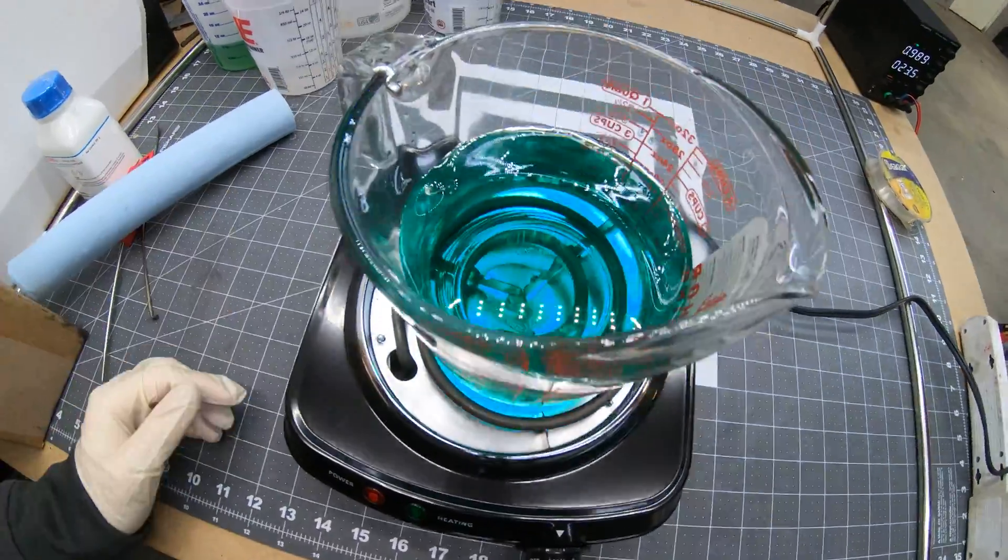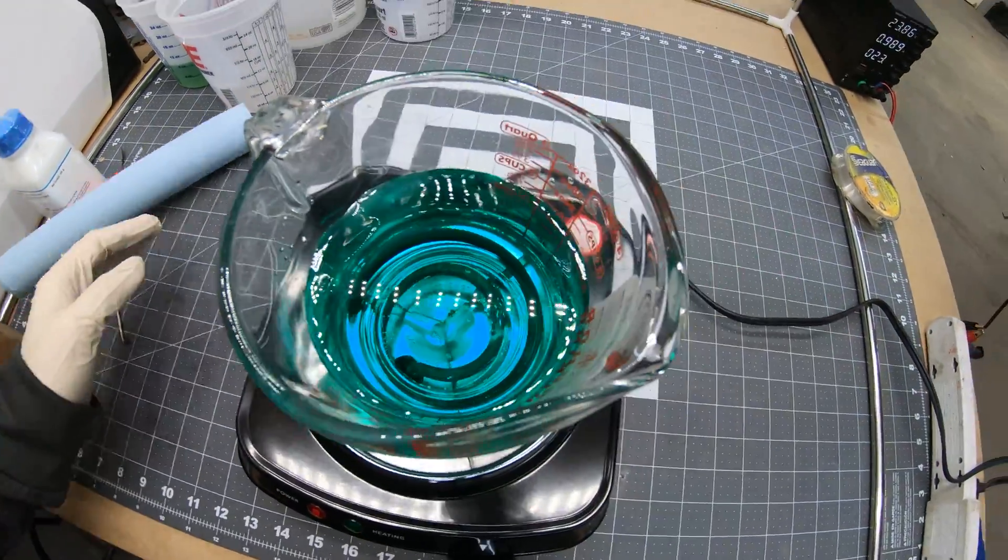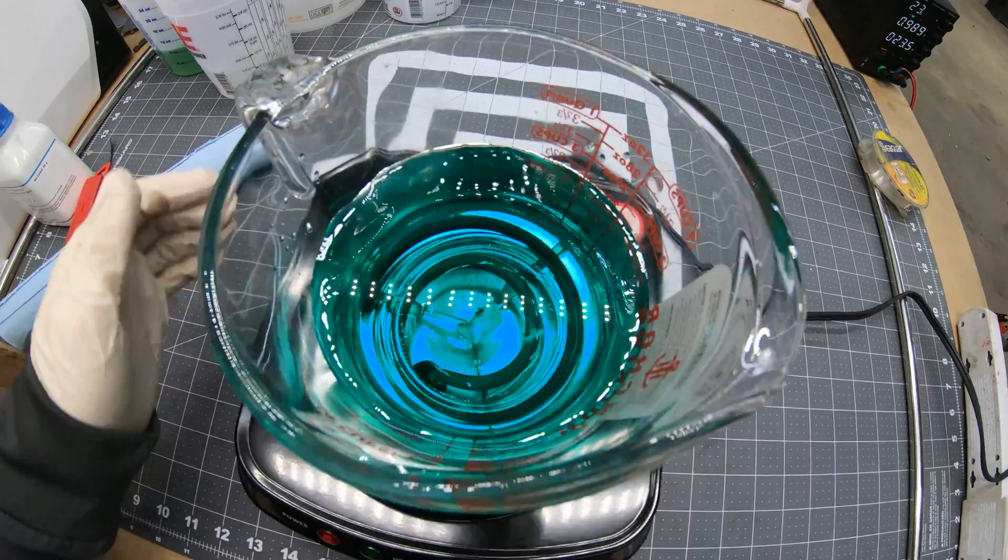The new solution looked absolutely beautiful. I don't know. I just love that color. Like it looks like it would be delicious to drink it, but it would probably kill you.